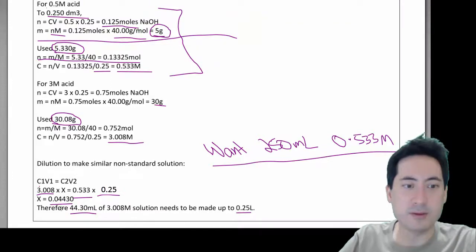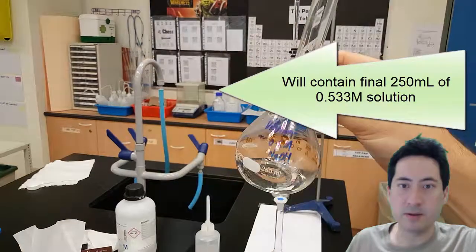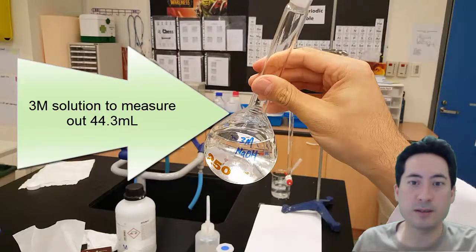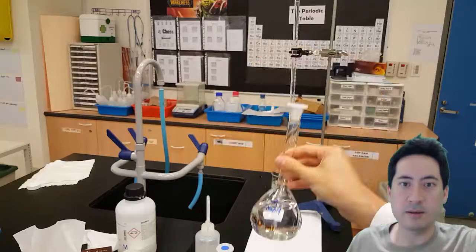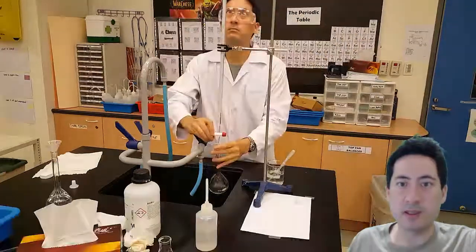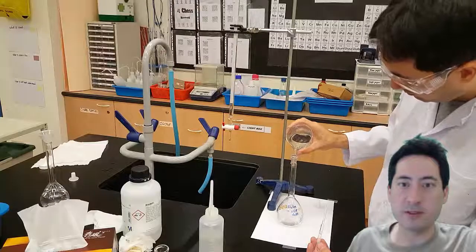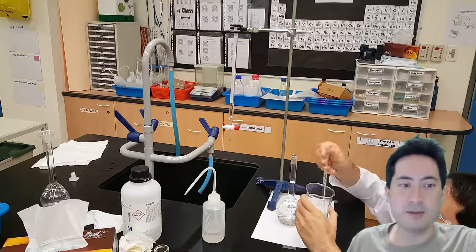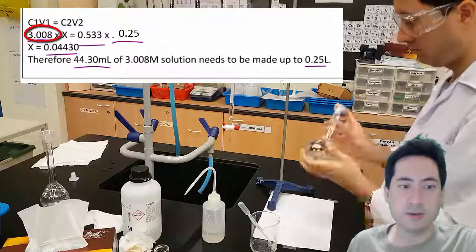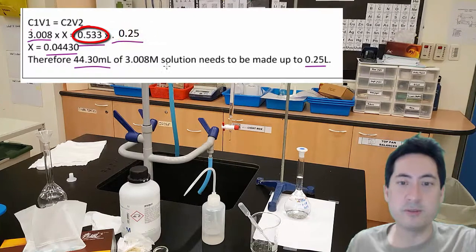Okay, so let's go about doing that. So I have my volumetric flask here that I'm going to fill, and here is the volumetric flask that contains the 3 molar standard solution, and so I fill in the burette so I can get 44.3 mils accurately in one shot, and so I measure it down to 44.3. I then fill up my volumetric flask and I make sure it's mixed, and now I have from a 3.008 molar solution I've created 250 mils of 0.533 molar solution.